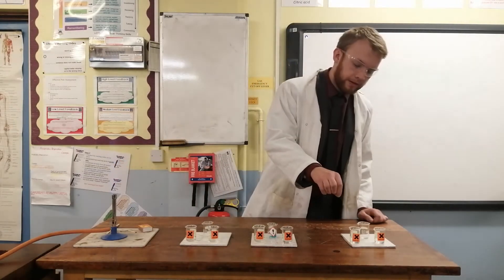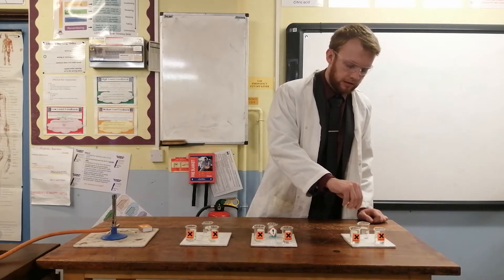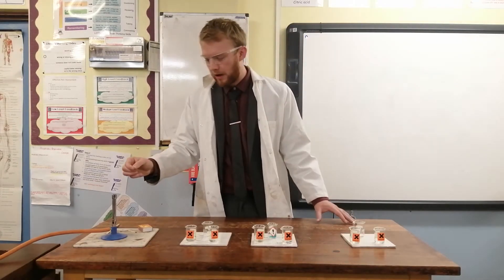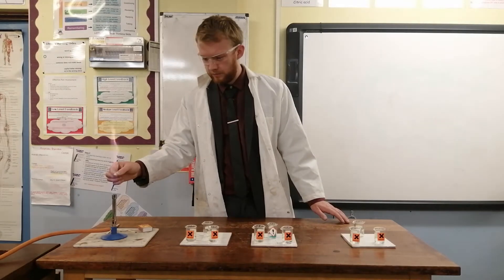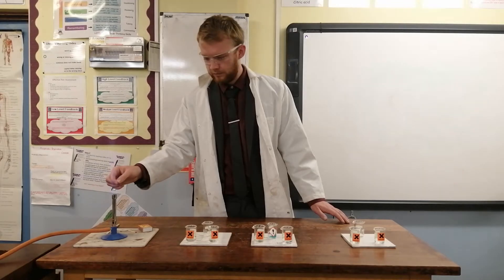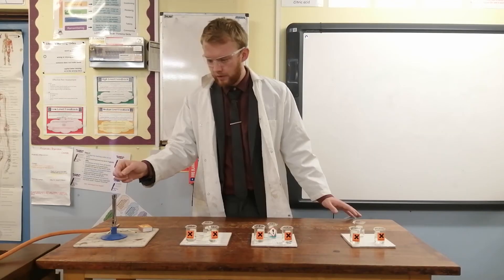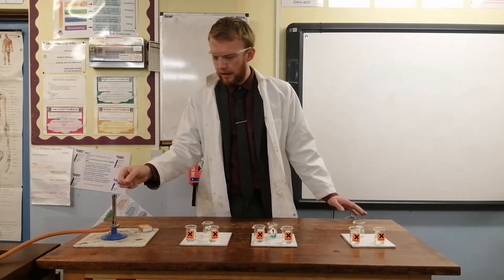I can then dip the wire into my hydrochloric acid and then into my metal salt to get a test sample onto the wire, and then place it in the hottest part of the flame, in the triangle just there. You can see we're getting a kind of lilac colour from this metal salt. With a lilac colour I know that I've got potassium.